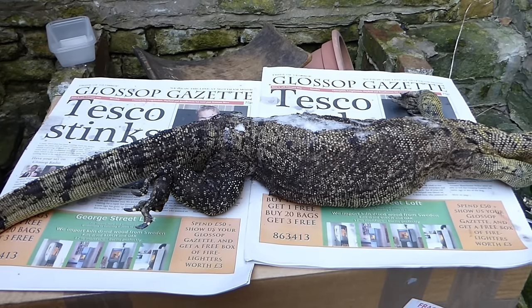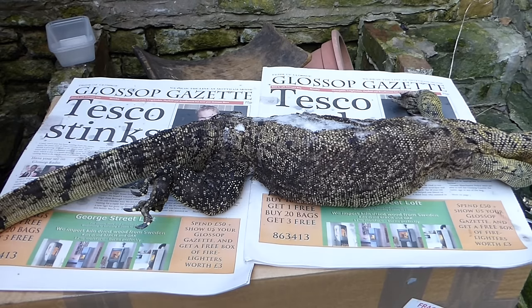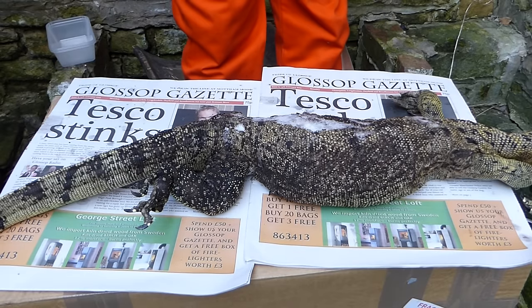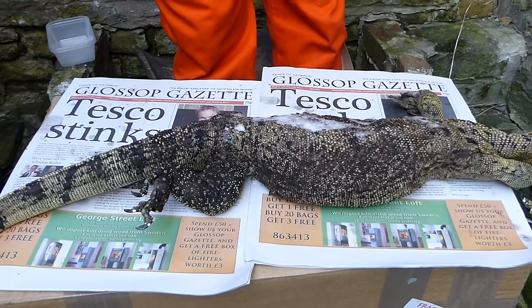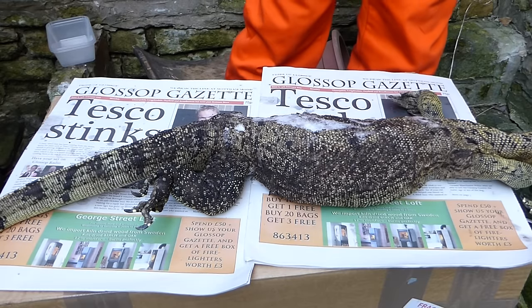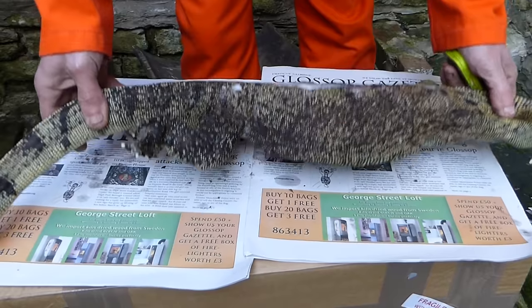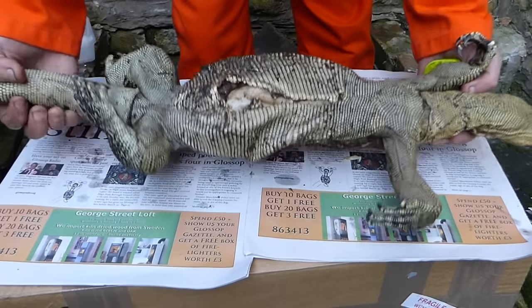Hello, my name's Daniel and today what I'm going to do is take this dead monitor lizard and cut it open, have a look inside it, and identify the major organs as far as we can — basically to show how easy it is. So if you've got one and it's died and you don't know why it's died, you could just have a look inside and see if it looks normal or not, once we know what normal is.